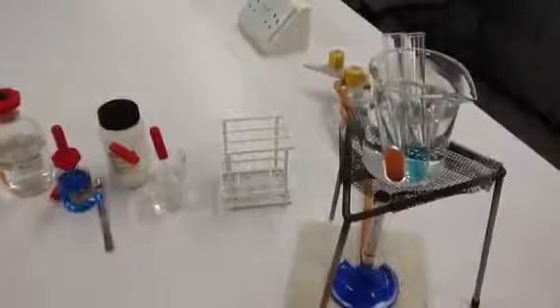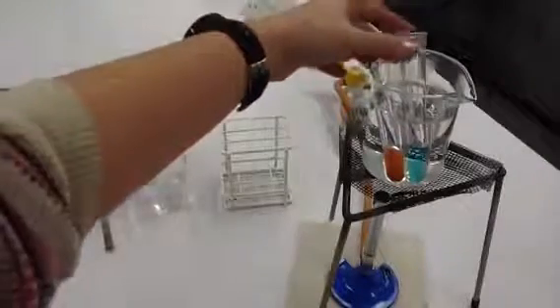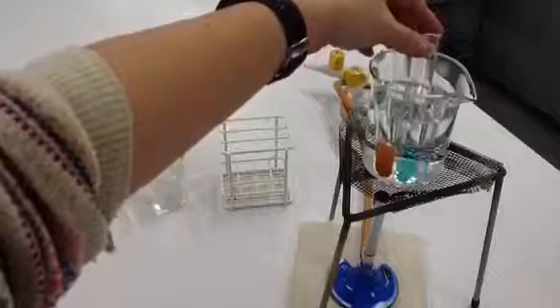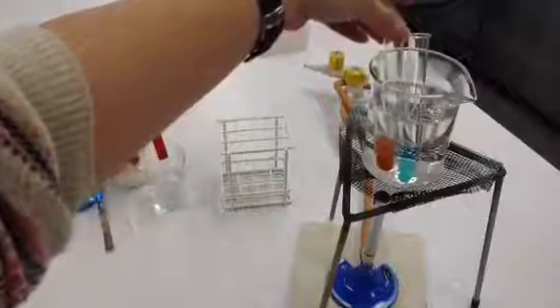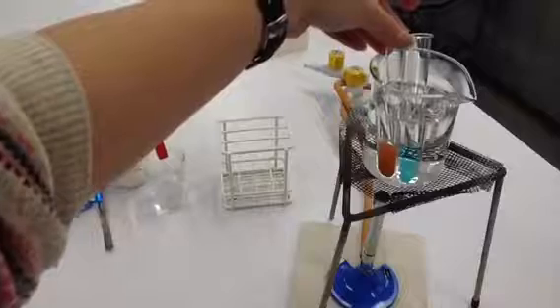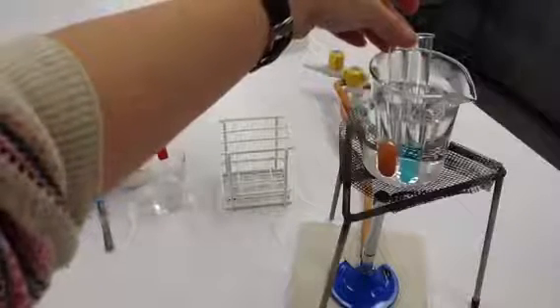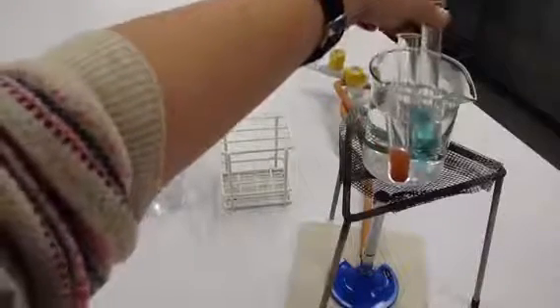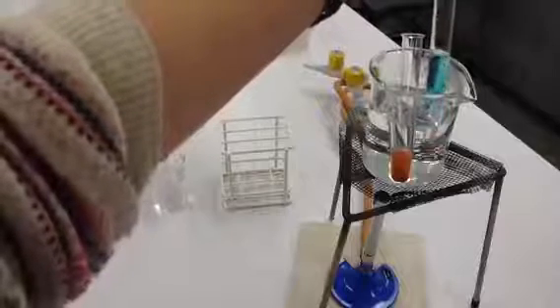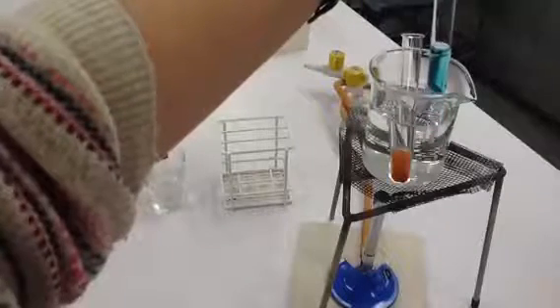So about 10 minutes has passed now and we can see that after that time, our sample B has now changed to that orange, nearly brick red color.